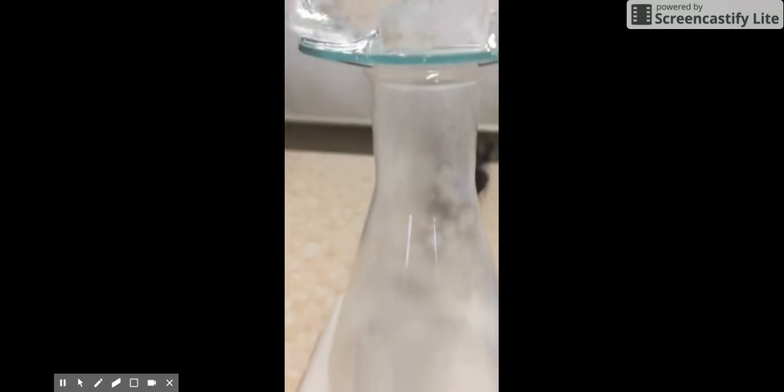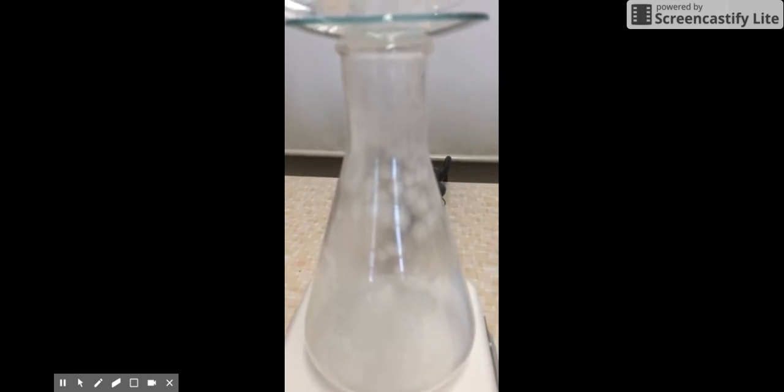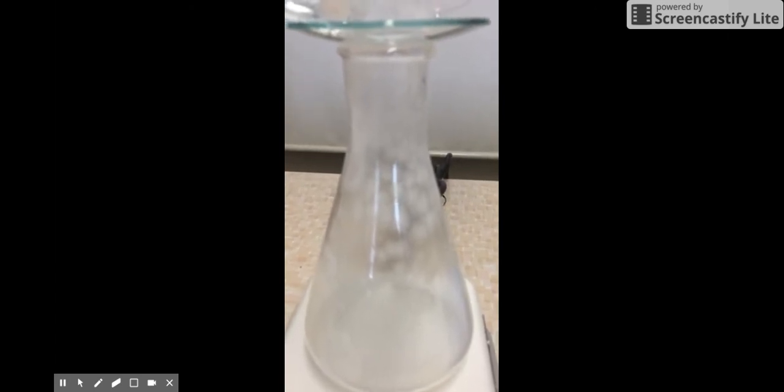So we can understand a little bit about temperature and how temperature can cause phase change or change in state of matter. We had heat at the bottom, changing a solid. We have cool at the top, changing a gas. It's a little fuzzy in that focus area, but you can still see on the sides of the glass, the crystals are beginning to grow larger. And what was once just a cloudy gas on the inside of this flask is now becoming solid crystals on the sides of the container where condensation first formed and now has cooled off.